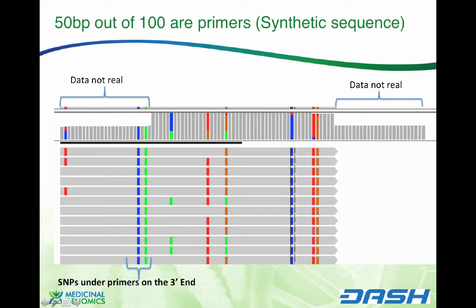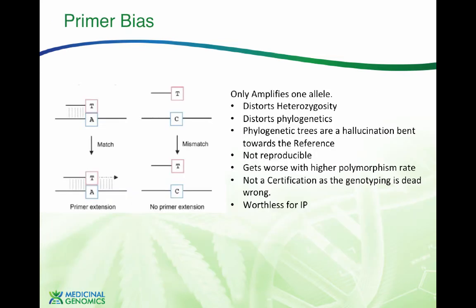And the reason why you sometimes see 3 alleles is usually a sign of mismapping. You're in a region that might have a copy number variation somewhere else in the genome, and so you start calling 3 alleles. This is a diploid plant. There should only be 2. And when there are 3, you're not mapping your reads correctly. And sometimes there's nothing you can do about that when you're dealing with short reads.